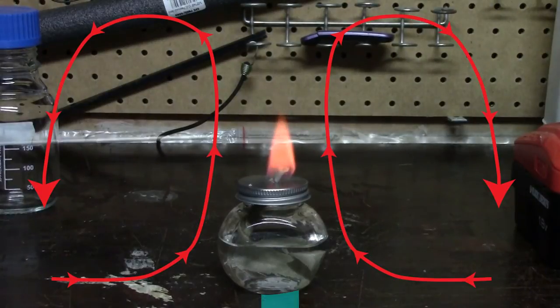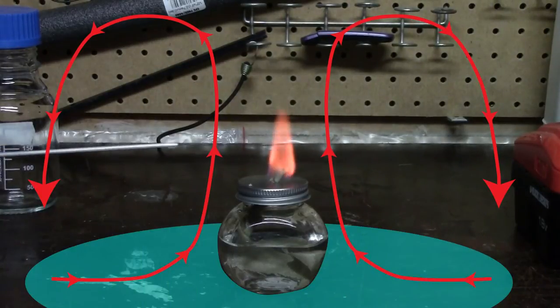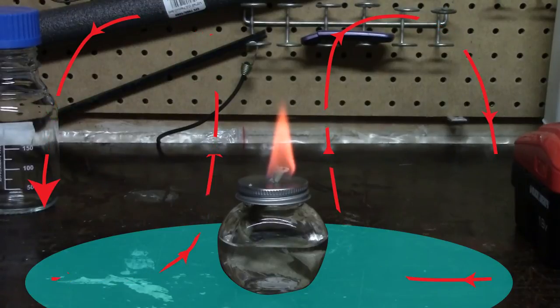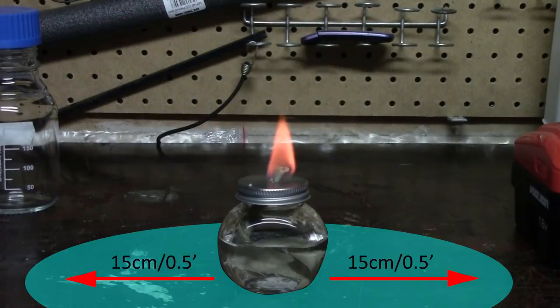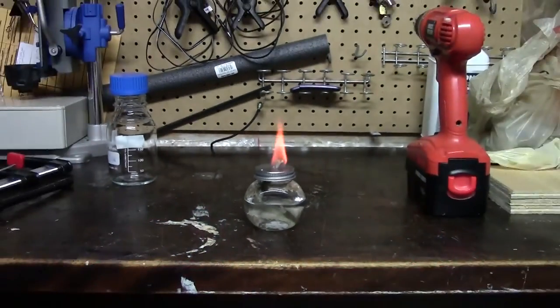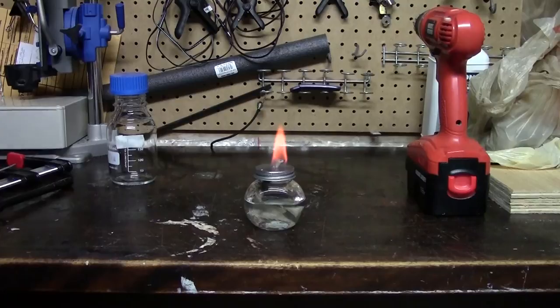What this then means is that there is a work area extending out about half a foot in either direction from the lamp where we can put objects and open tubes and know that they're going to be relatively clean.